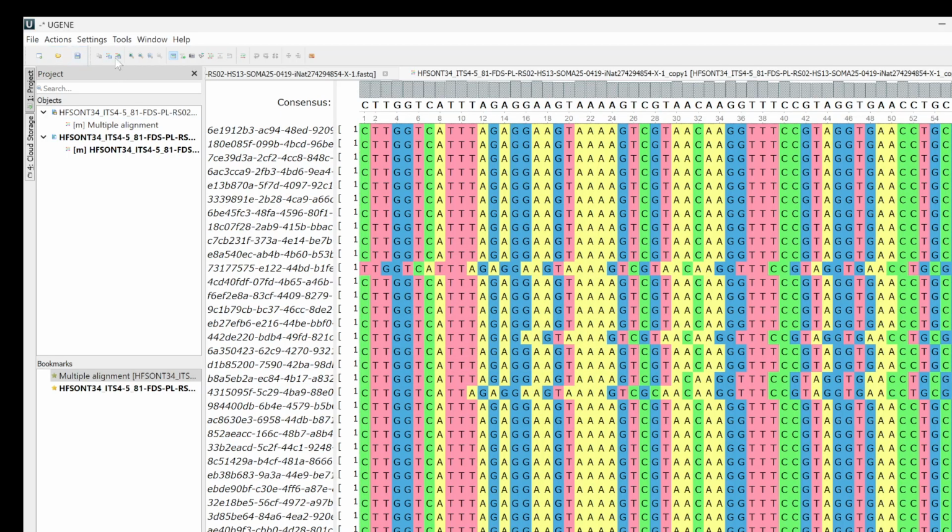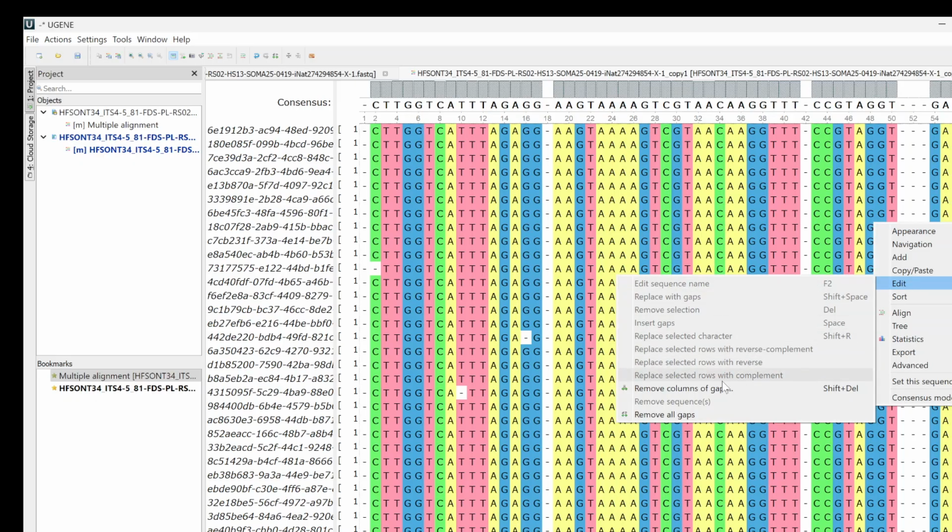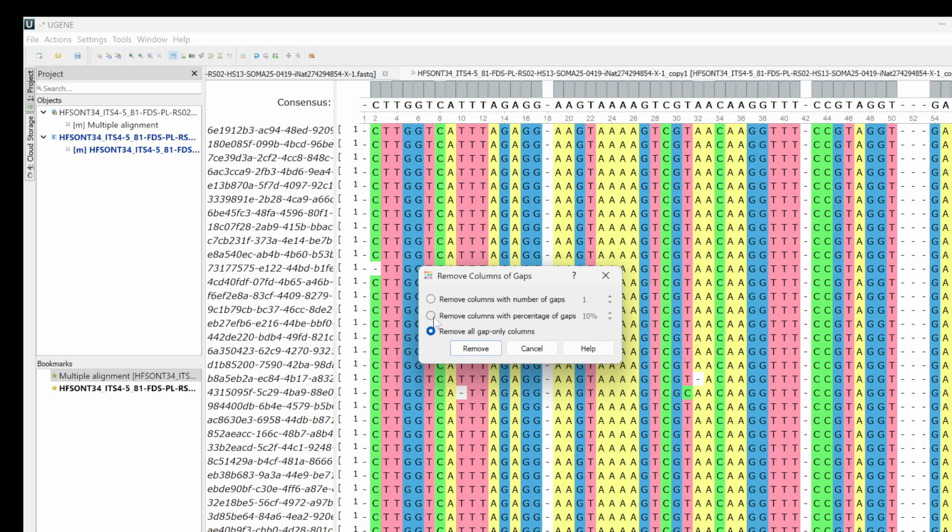Forgive me, the display scaling for my computer is a little funky. Okay, it's done. The next thing I'm going to do is remove columns of gaps. You can just do Shift Delete, but I'll show you where the menu is there. I want to remove 90% there, so any of these columns where 90% of it is just empty space, we're just going to get rid of them.